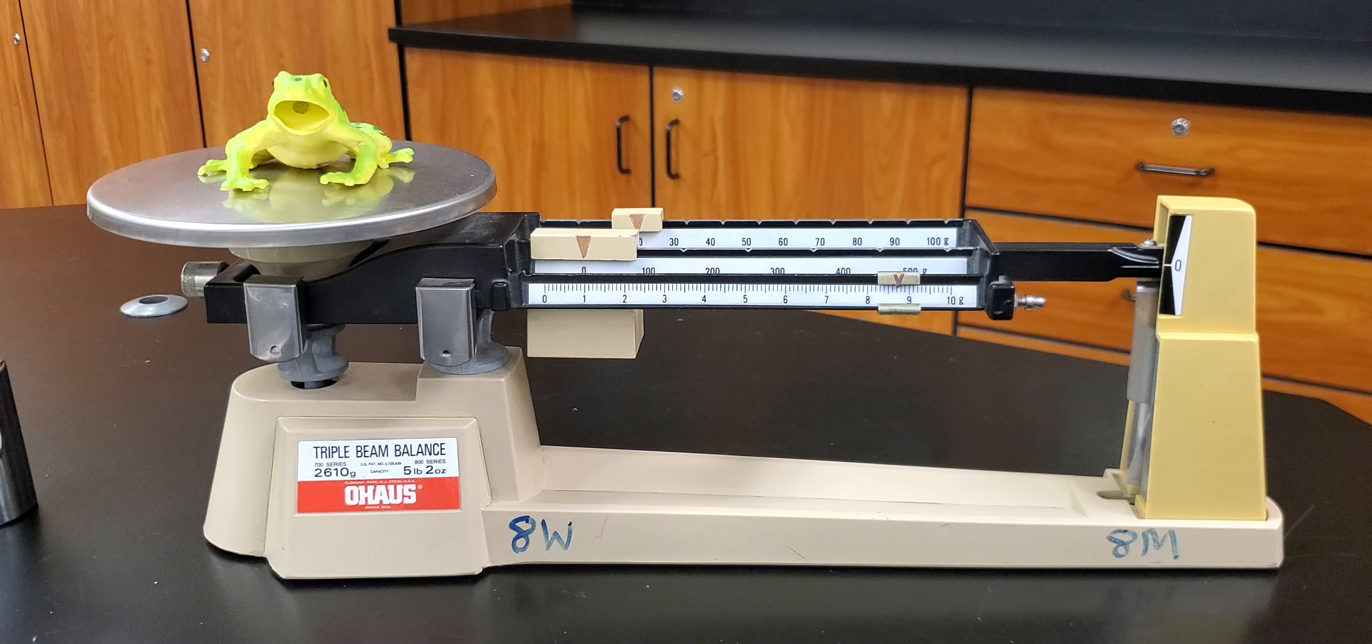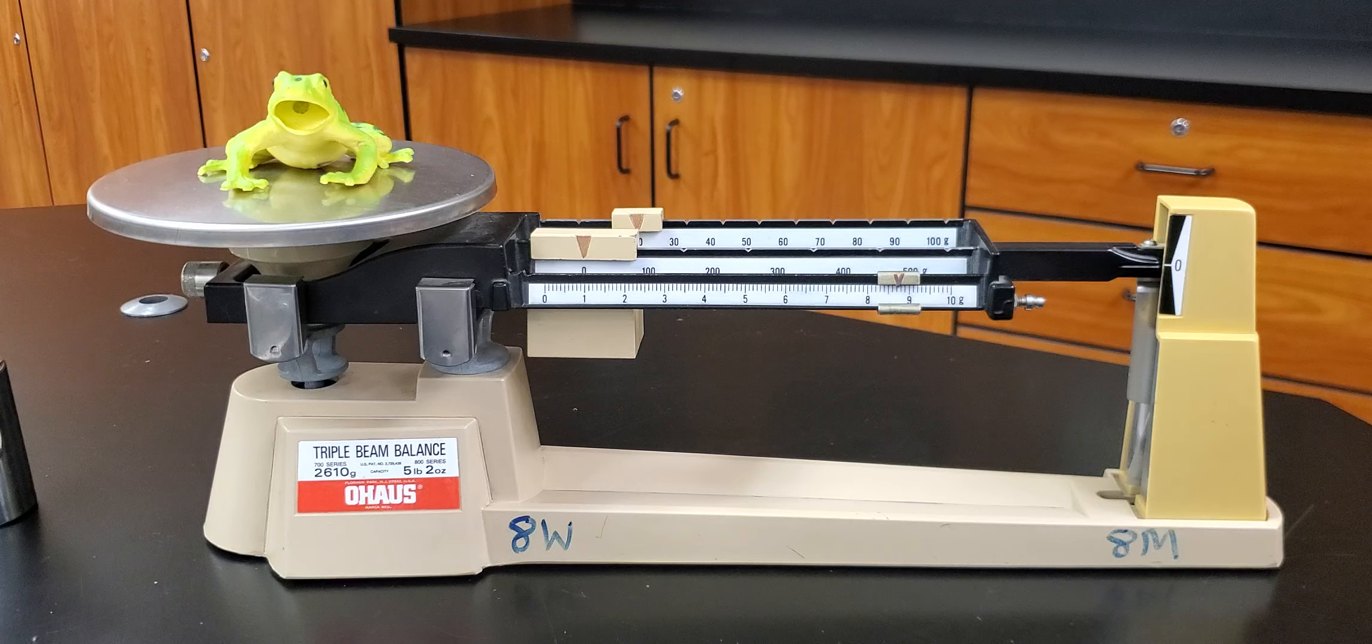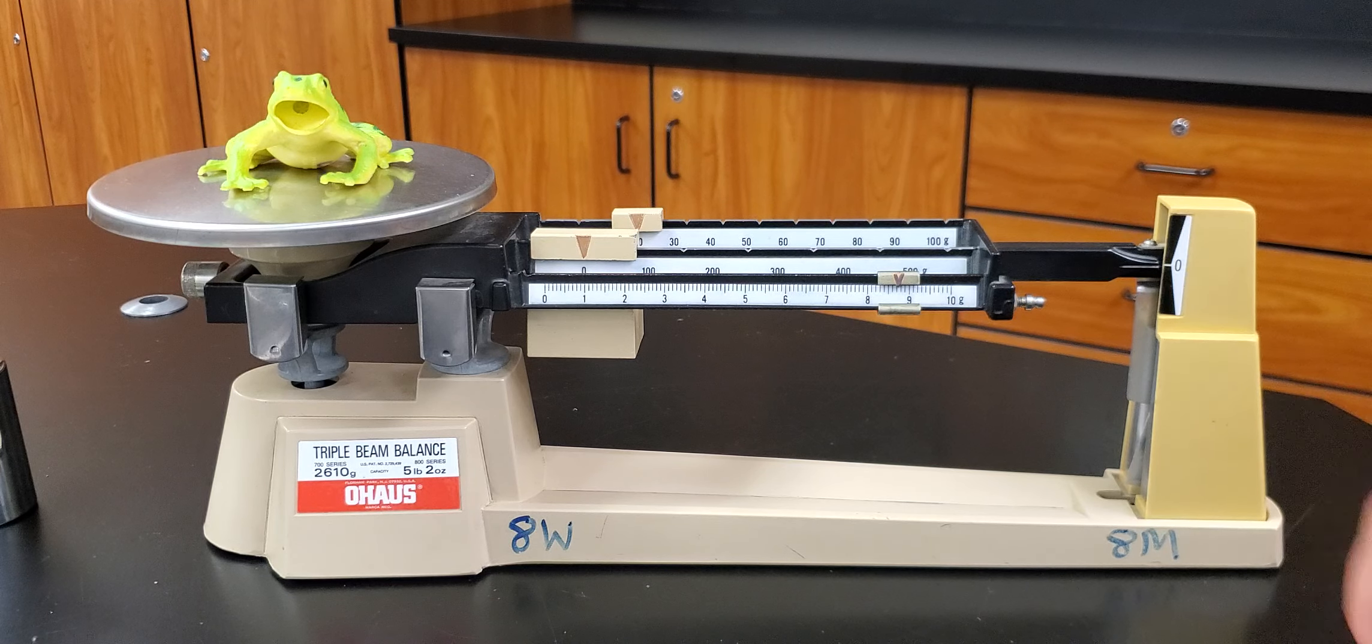Make sure it's really important that we put that unit on there. Don't just say twenty eight point seven, twenty eight point seven grams.